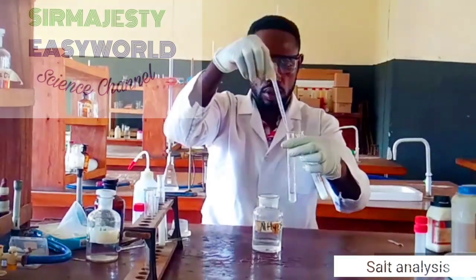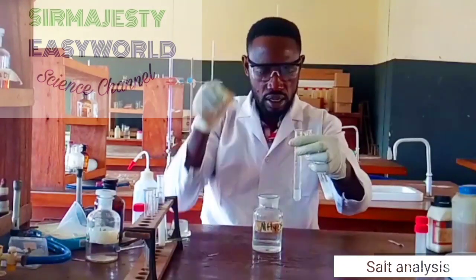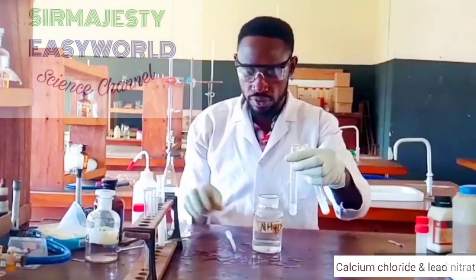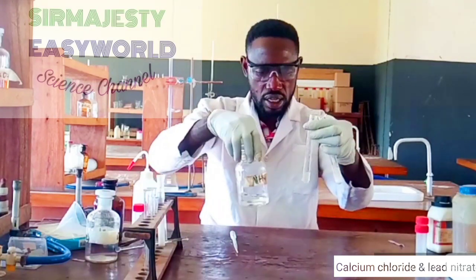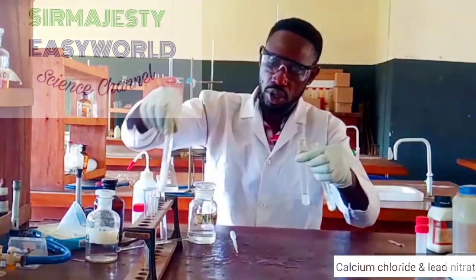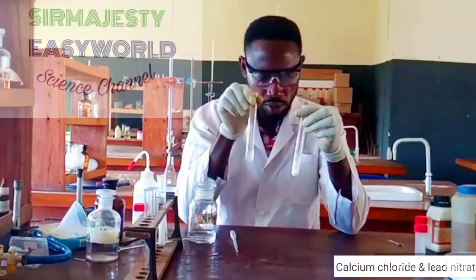Then with calcium and ammonia, there is slight turbidity in drops. Slight turbidity. So calcium ion forms slight turbidity with aqueous ammonia, unlike the white chalky precipitate obtained when we use sodium hydroxide against calcium. But with aqueous ammonia, it's just slight turbidity.